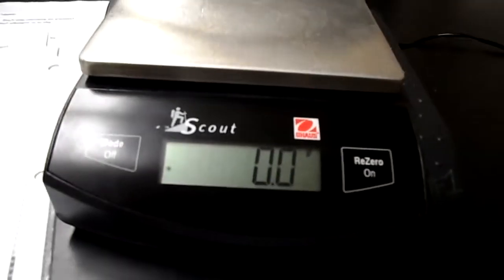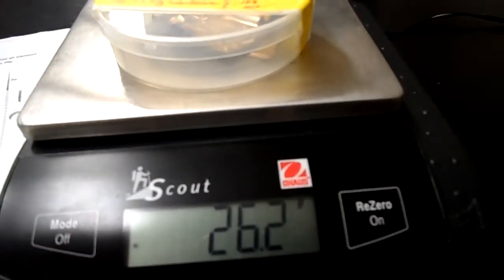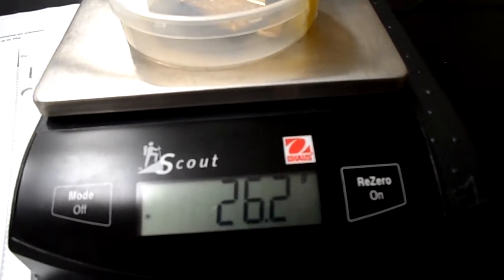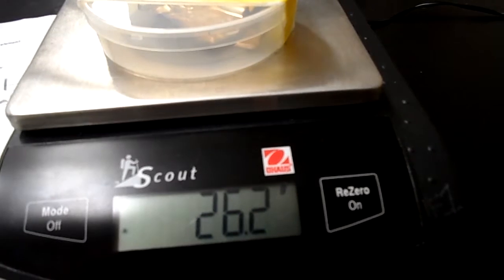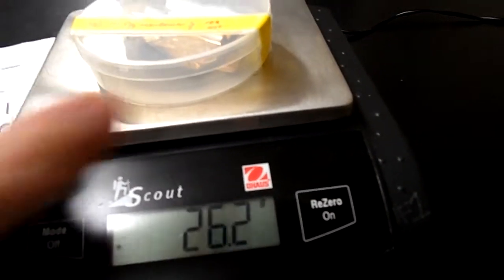And the final element, number 12. The container is 14.5 grams. The mass is 26.2, that is the container plus the element, and this also has a molar conversion, and that is reading 0.109 moles.